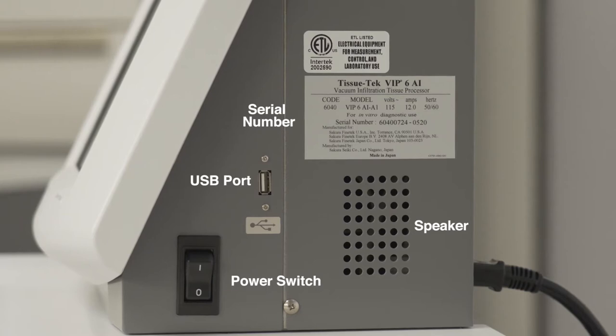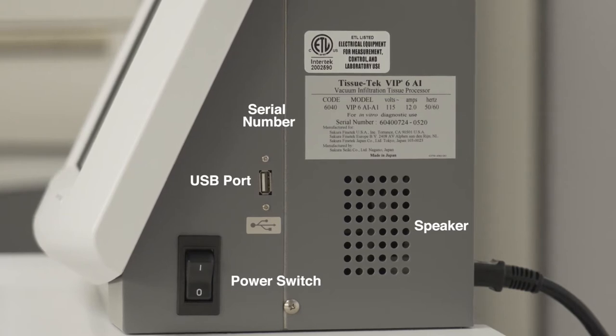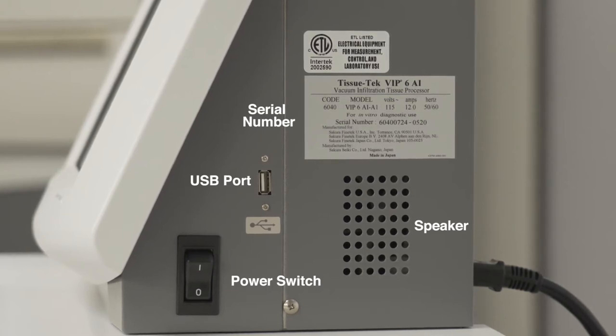The serial number can be viewed by accessing the utility menu and selecting software version and serial number.